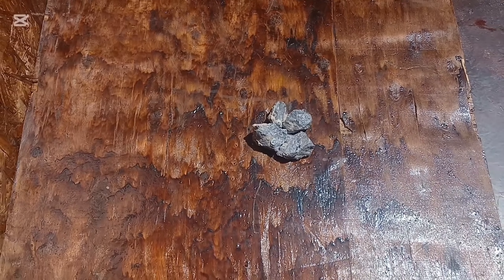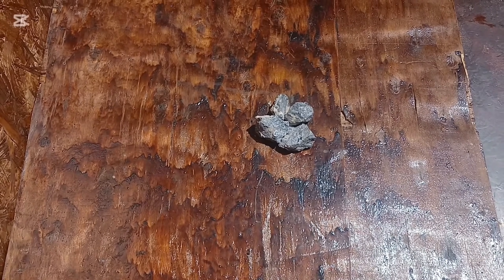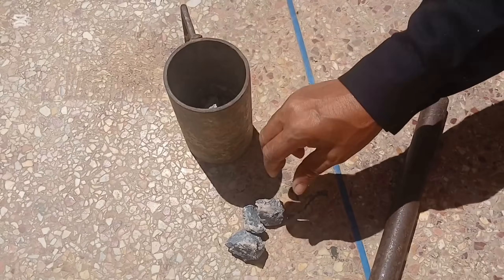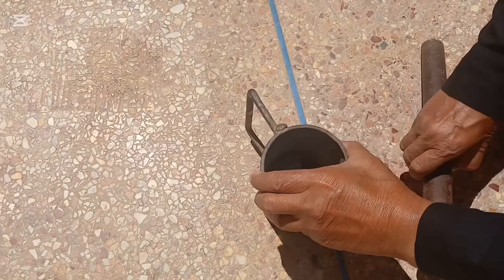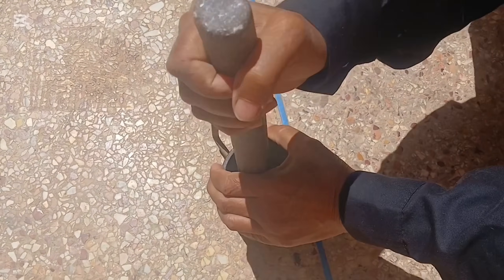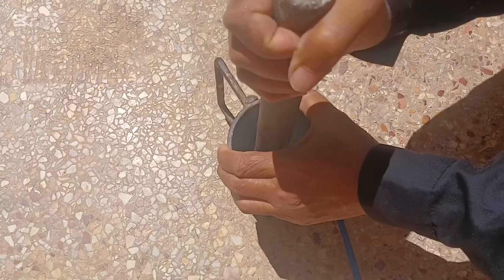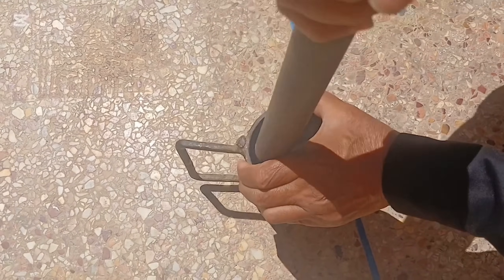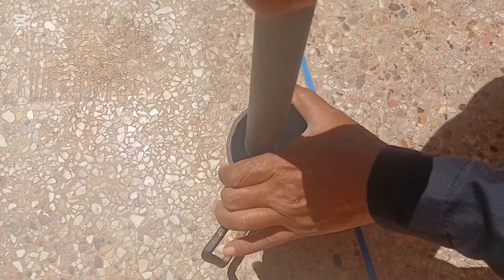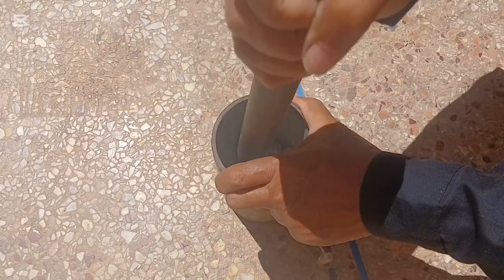This is not just about gold — it's about learning, experimenting, and mastering the process. Many rocks found in nature, especially black sands, volcanic materials, and ore veins contain a complex mix of metals. While most people think only of gold, they often overlook hidden treasures like iridium, one of the rarest elements on earth, or cobalt and nickel, essential for modern batteries and electronics.